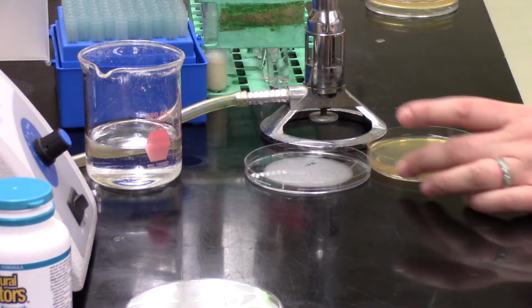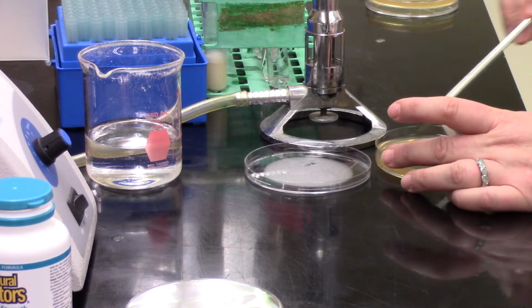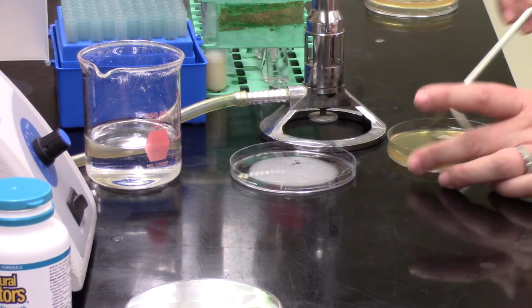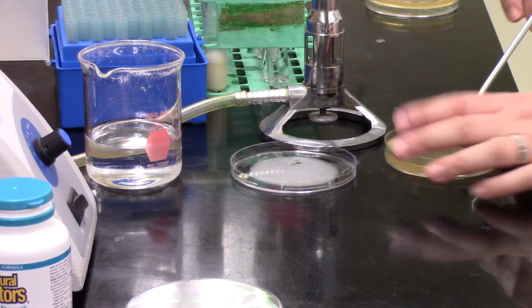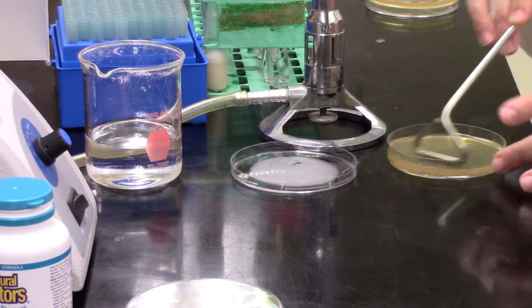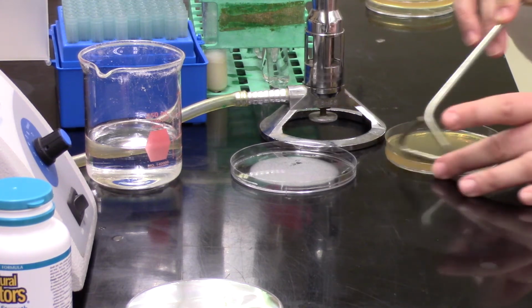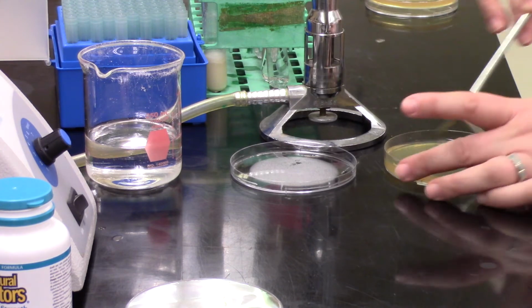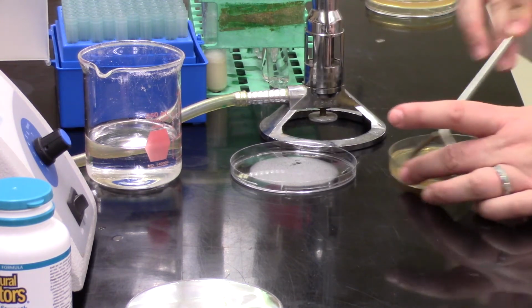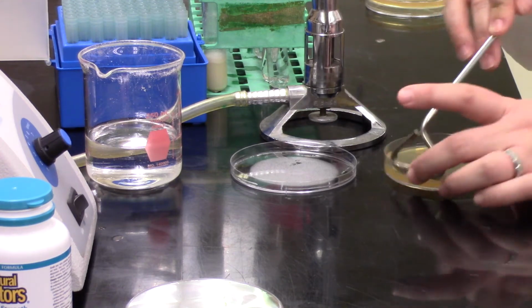And then she's going to start the process. One thing you can do, and she just demonstrated that there, just like we talked about with the loops, after you've sterilized your loop, you can touch it to a spot on the plate where there's no bacteria and see if it sizzles. If it sizzles, it's way too hot to start touching any bacteria with that loop. Same with the spreader. If you touch it lightly to the agar, you should see that it's not sizzling at all. It's not burning into the agar.